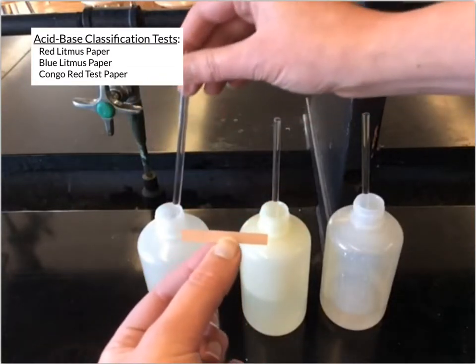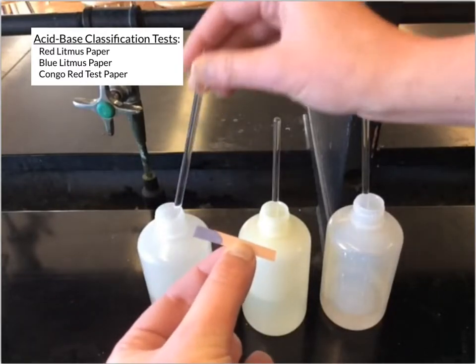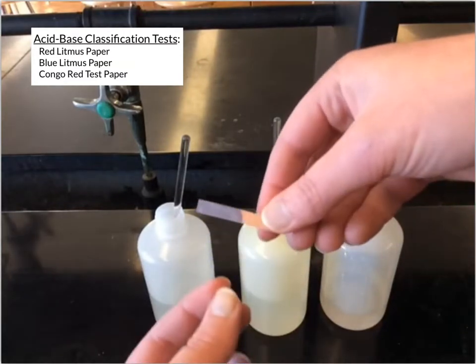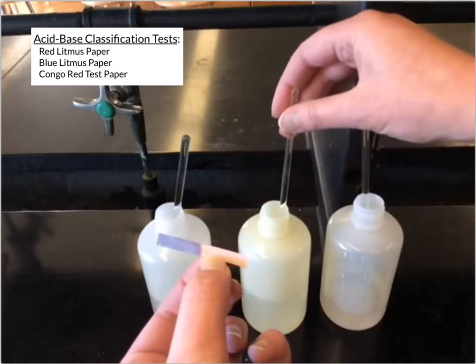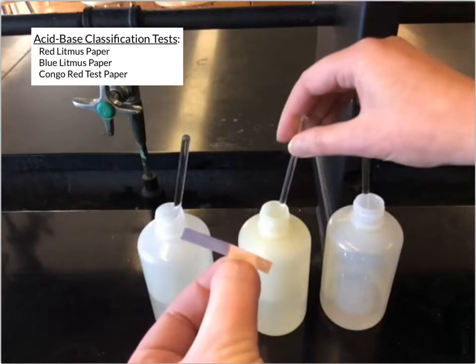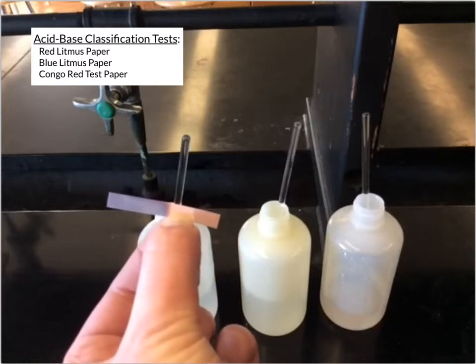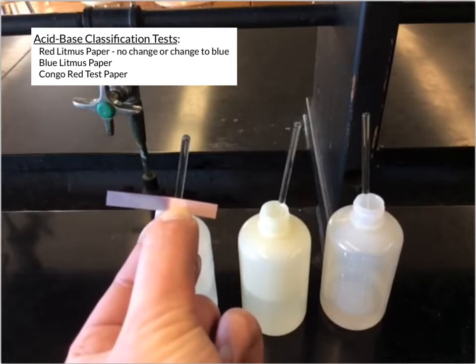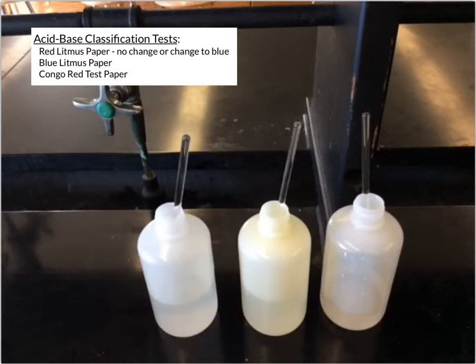And so I'll start with this first solution that I've got, and you see that I put it on that red litmus paper, and that paper is turning blue. And if I use a different substance, I put it on the red litmus paper. Now what you see is there's no real change, it's just wet. So it didn't change colors. And so that's what you see when you use red litmus paper. A substance is either going to have no change with the red litmus paper, or it's going to cause that red litmus paper to turn blue.